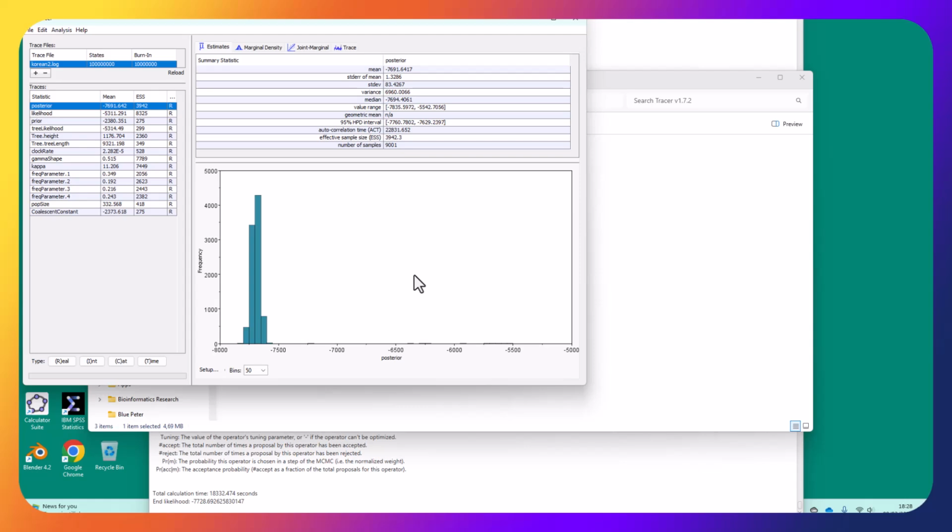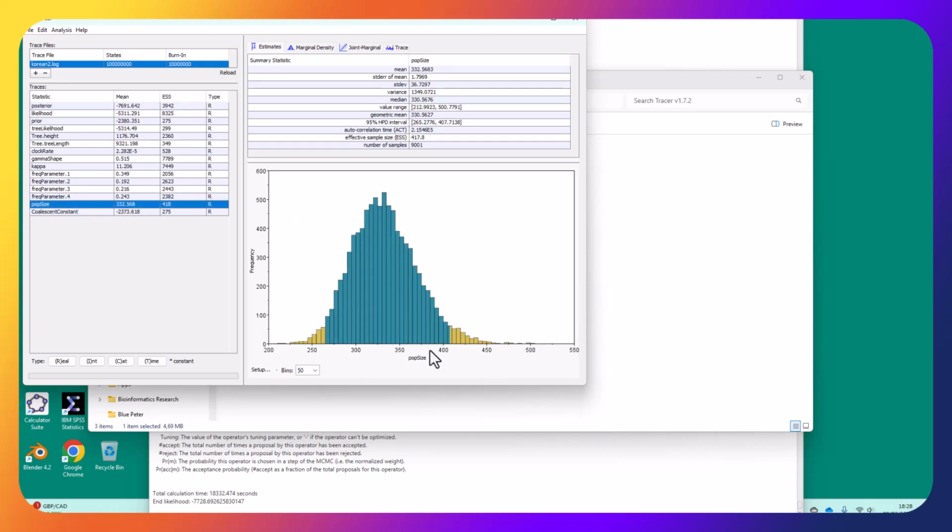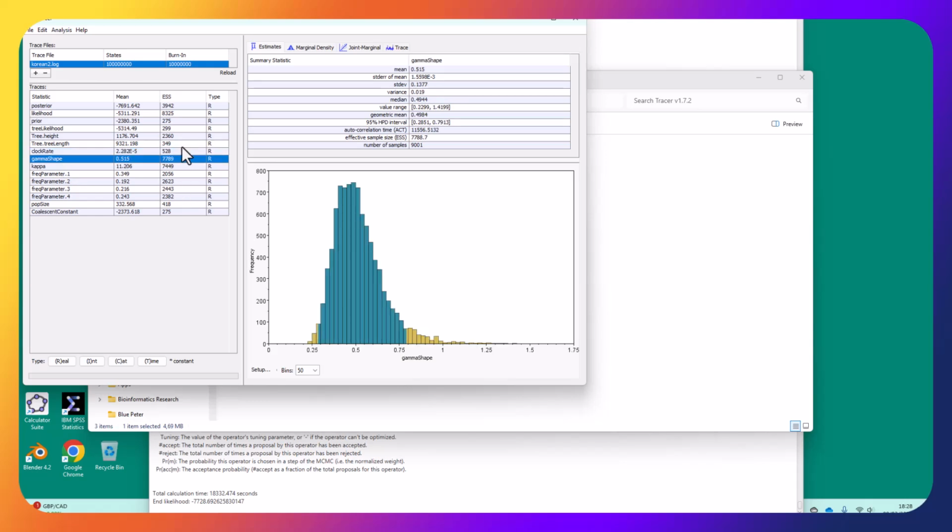Fantastic. That's what I like to see. So this worked. You can see from the sampling in this ESS column, all of them are now in black, none of them are highlighted in red or yellow as being undersampled. The model has been well fitted, it's got a constant population size of 332. If I have a little look at the spread of them, they're quite reasonably set up. I've got a good clock rate, I've got good convergence on my gamma shapes. Everything from this is good. That is a well formed model.